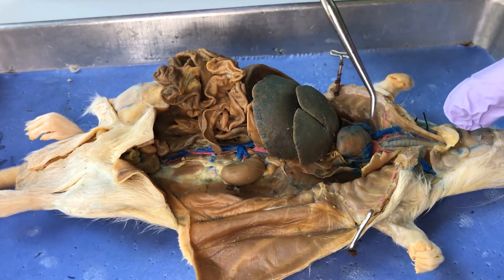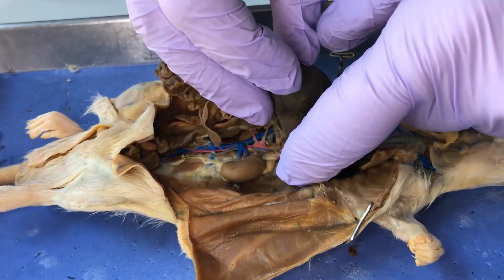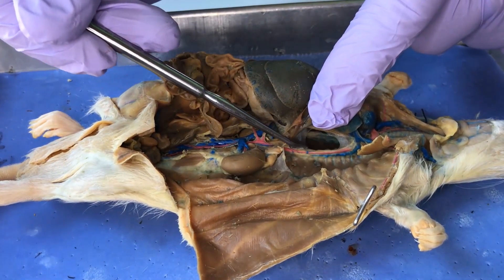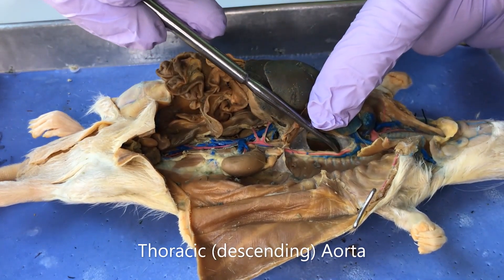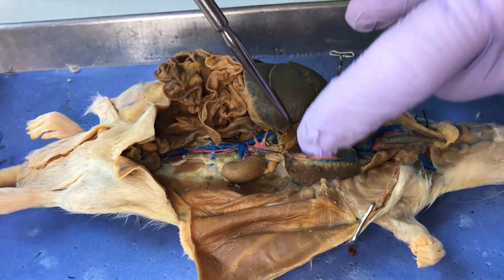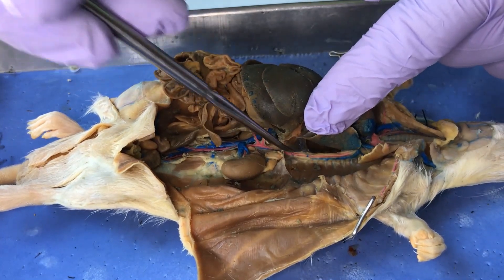I've flipped the rat around to examine it from the other direction — hopefully that's not too confusing. You can see the aortic arch again right here. Looking underneath all of these organs, you can see the aorta as it continues down through the thorax. This is called the thoracic aorta, or descending aorta — either is fine, as long as it's going downward. As it passes the diaphragm, which separates the thorax from the abdomen, the thoracic aorta becomes the abdominal aorta.